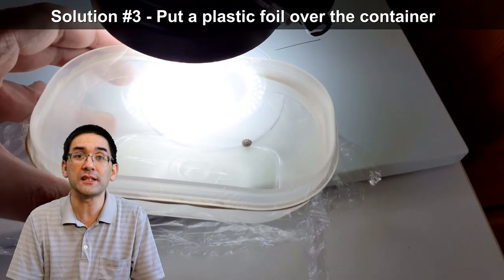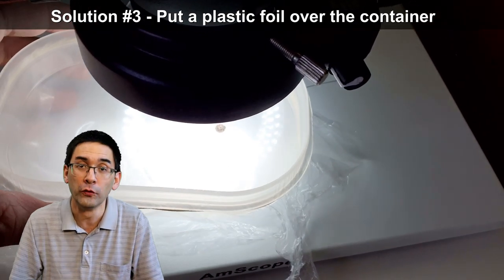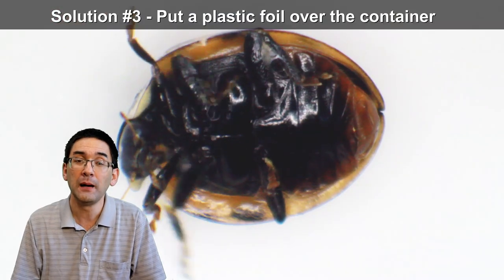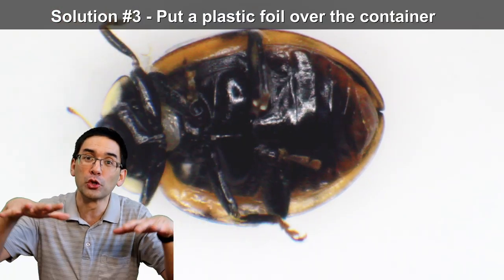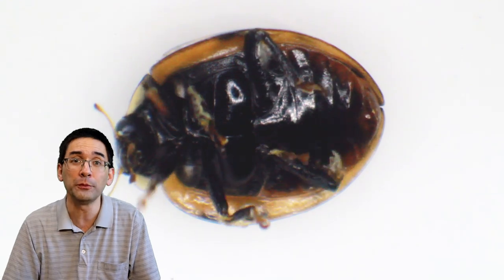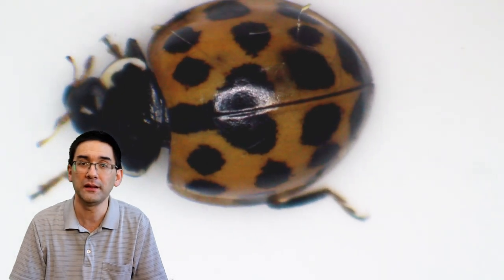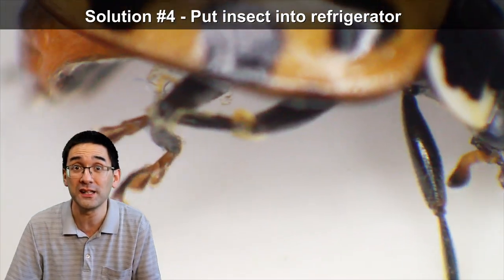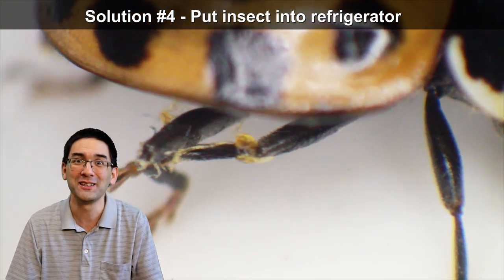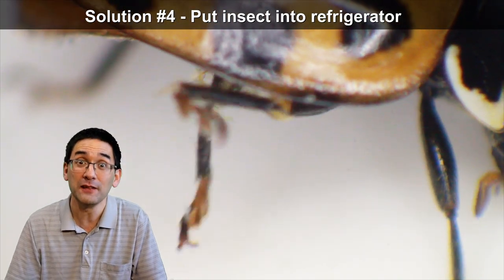If you don't want to kill insects, you can put them into a plastic container and put some clear foil over it, like I've done here. The insects cannot fly away and you can observe them directly through the clear foil. This still causes the insect to move around, but it limits their movement so at least they can't run off your microscope stage or fly away. You can simply recenter the dish, take pictures, and the nice thing is the insects are still alive — this ladybug, for example, is now cleaning its legs.